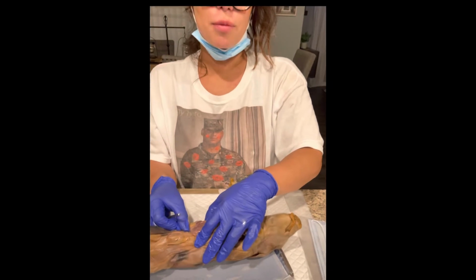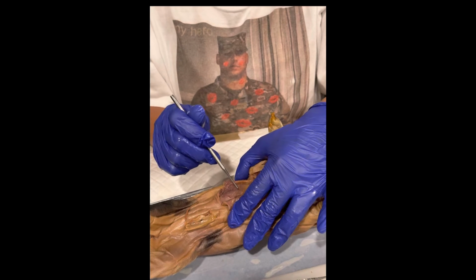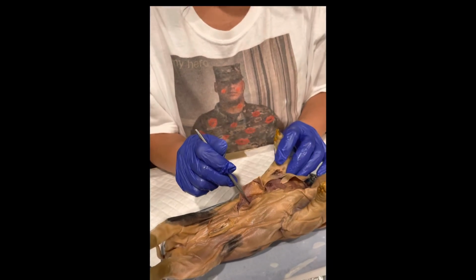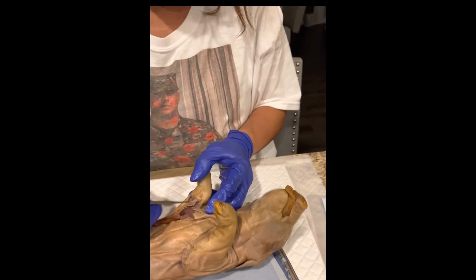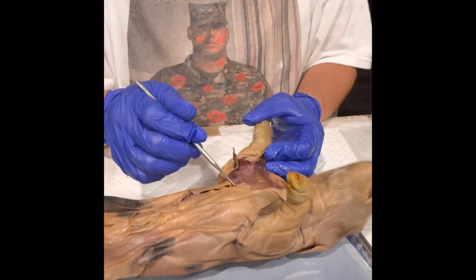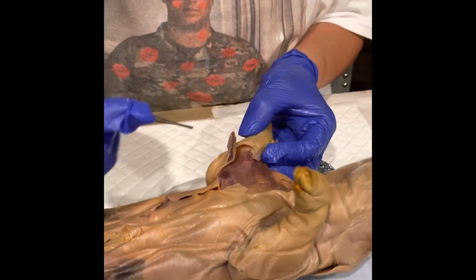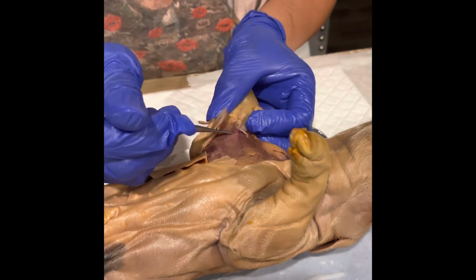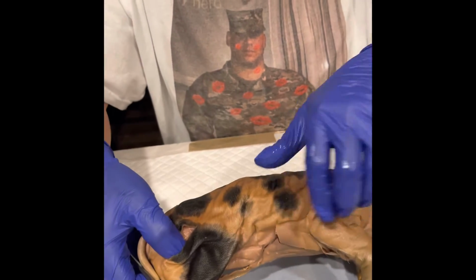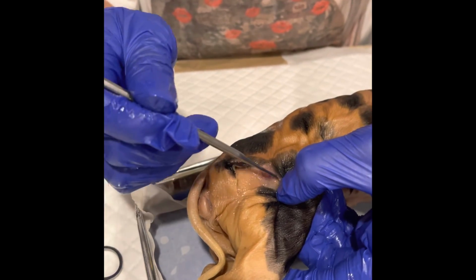Just near the rectus abdominis, which we previously had located, we're going to locate the transverse abdominis, which is right in this area here. Going back over to the latissimus dorsi, closer toward the deltoids. Moving back over toward the upper region, we will locate the latissimus dorsi, which is right in this general area here. And lastly, flipping our fetal pig over, we are locating the gluteus medius right on the back end toward its bottom.